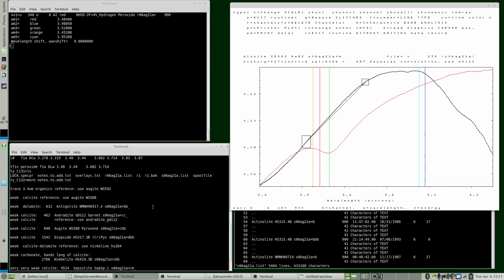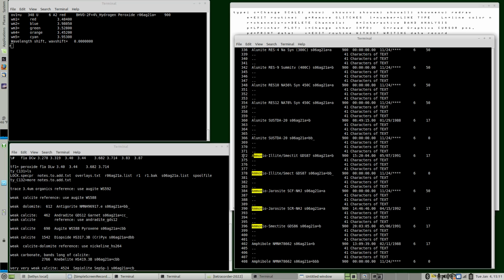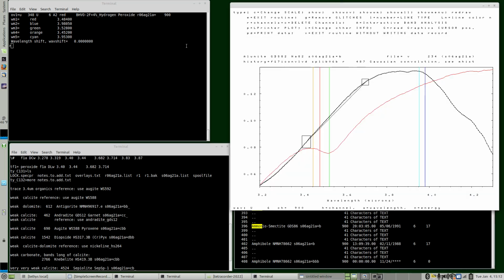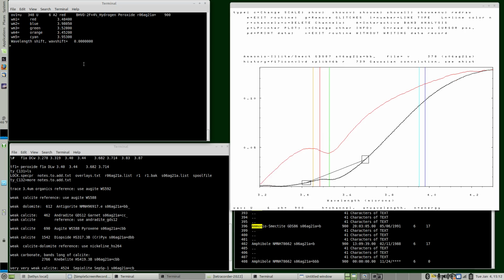So after going through them, I found a couple of possibilities. Let's go to 372. Well, let's go to 378. So this is an ammonium illite, and it has a broad feature very similar. After looking at a number of ammonium compounds, it seems that what this was matching in the Tetracorder expert system wasn't hydrogen peroxide, it was ammonium compounds. I mean, think about it, fertilizer and animals out there, there likely could be ammonium products in the soils.